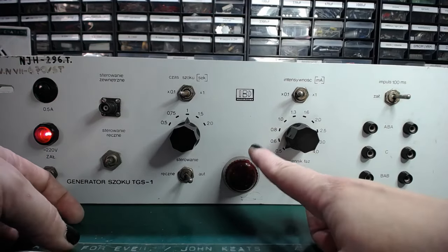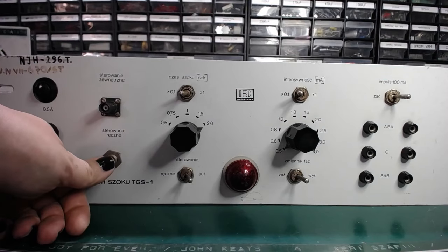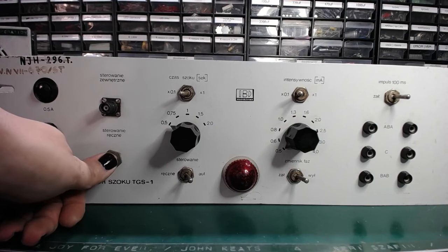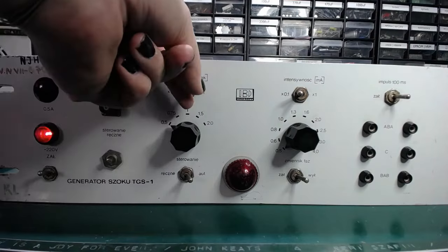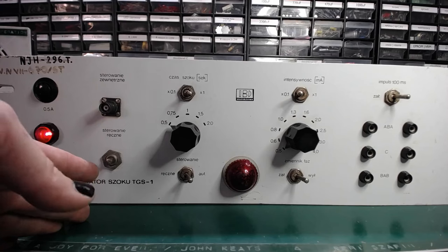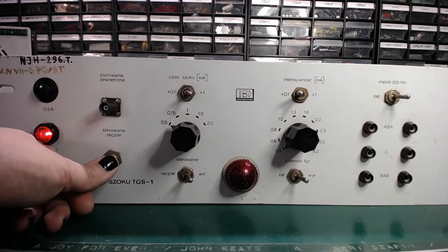So this was a short pulse, but if I change the time constant to twice as long, it's clearly longer, and half of the original value, you almost haven't noticed it. And let's do it times one. So this one should be half a second. If you noticed, first the initial startup time is way longer, and the shock duration is longer.